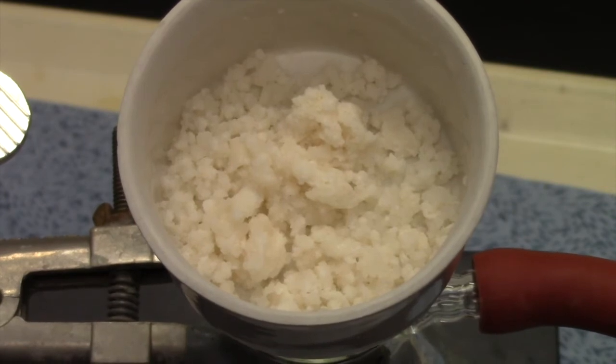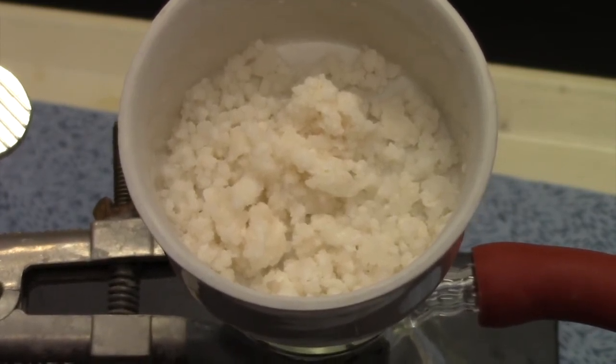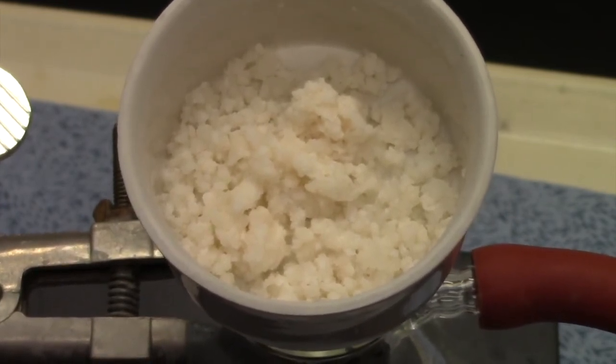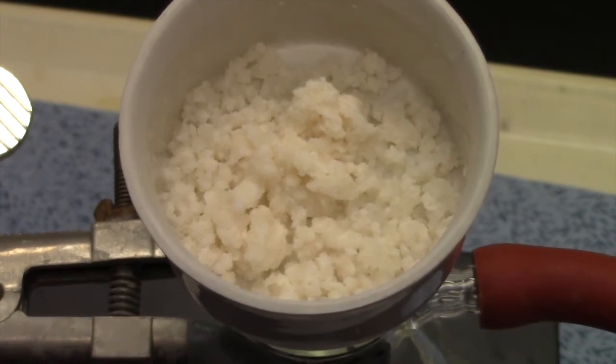Now the next step is I'm going to do a quick weight of it. It's going to be a wet weight, so the mass of the water is going to be included in the soap. The best thing to do if I really had time is I would wait a couple of weeks, let the soap dry, and then get the mass of the soap at that point. But there's really no need to do that. This lab still drives the point home. Alright guys, let's go weigh it.